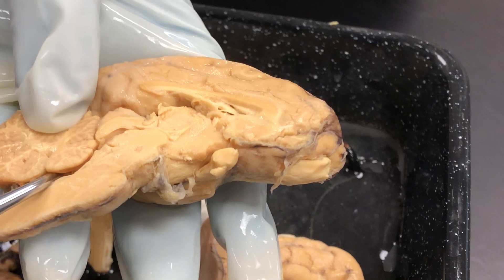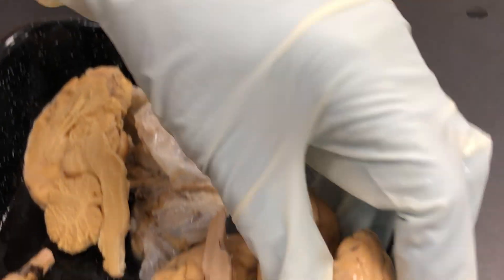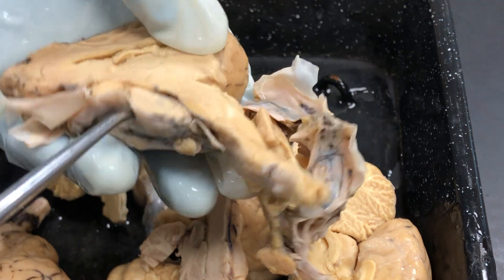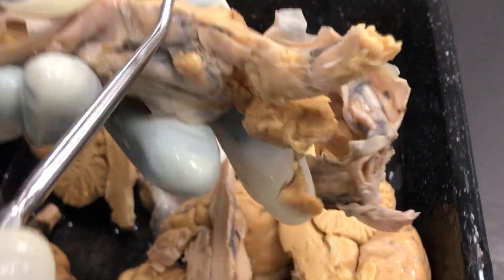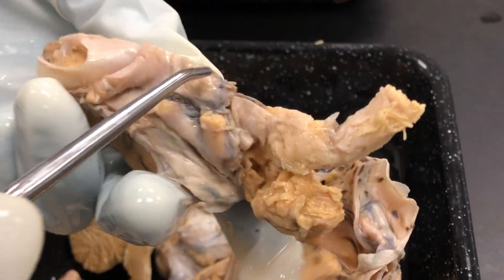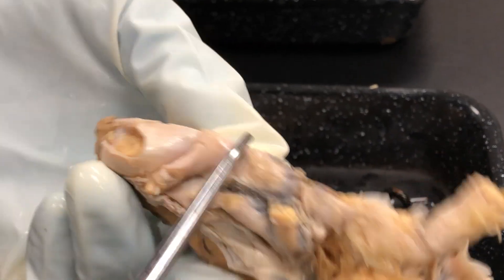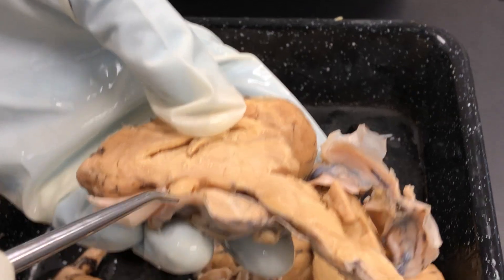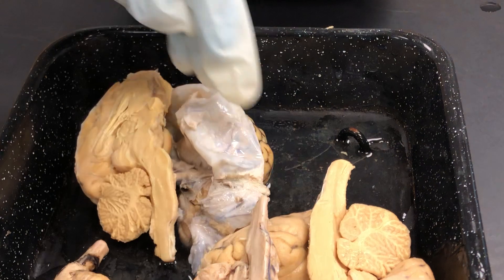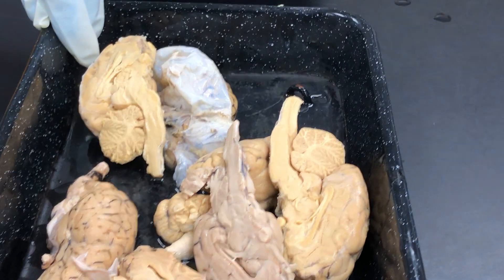It's helpful to show a sagittal view of the pituitary gland in reference to the optic chiasm, because they can often be confused. Here's the pituitary gland — notice it's being pressed close to the rest of the brain by the dura mater. Usually it sits in the sella turcica of the sphenoid bone, which is what holds the pituitary in place. And this is the optic chiasm, and right behind it we have the pituitary gland. Those are all of the structures we need to identify on the sheep brain.